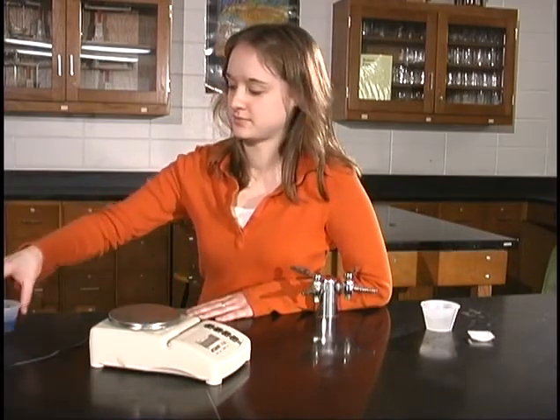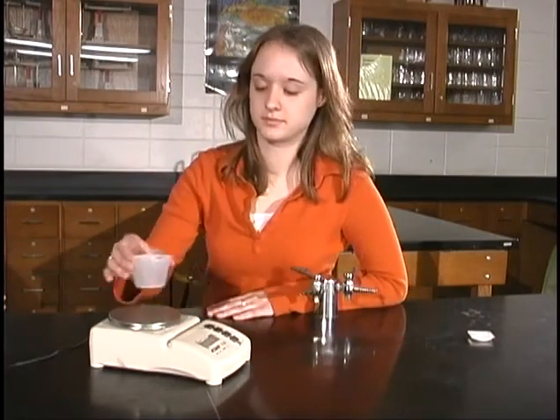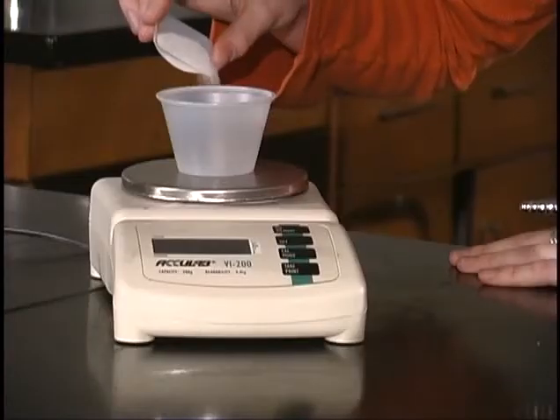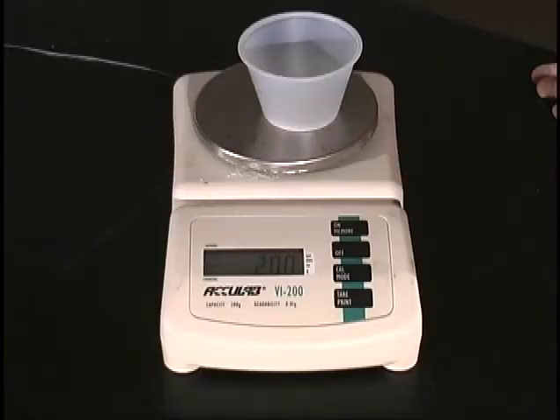definitely come in handy. Let's suppose we need to measure 2 grams of salt. We can place an empty cup on the balance and push the tare button. Then, we keep pouring salt into the cup until the balance reads 2.00 grams. Thanks to the digital balance, massing is fairly simple.